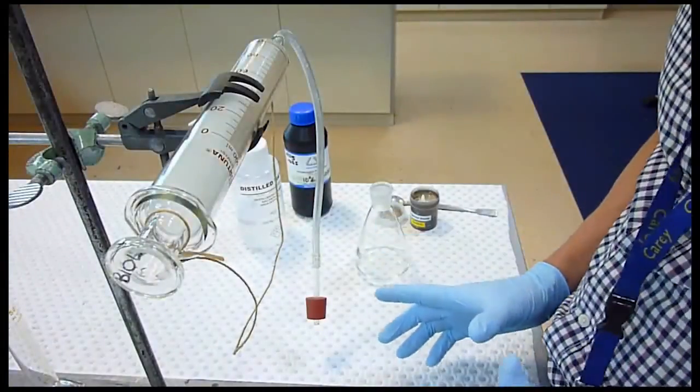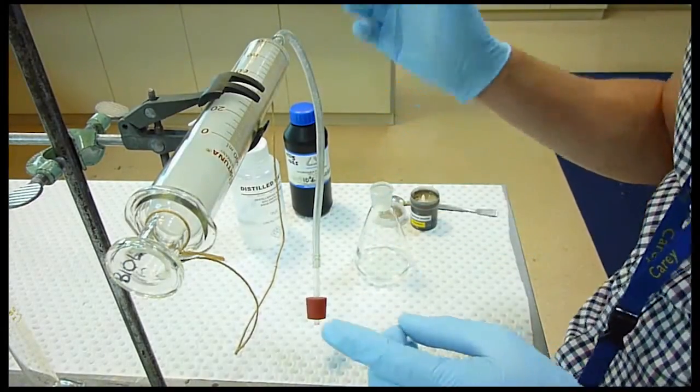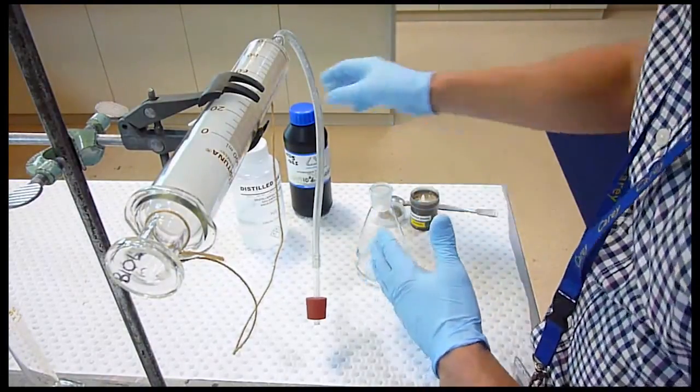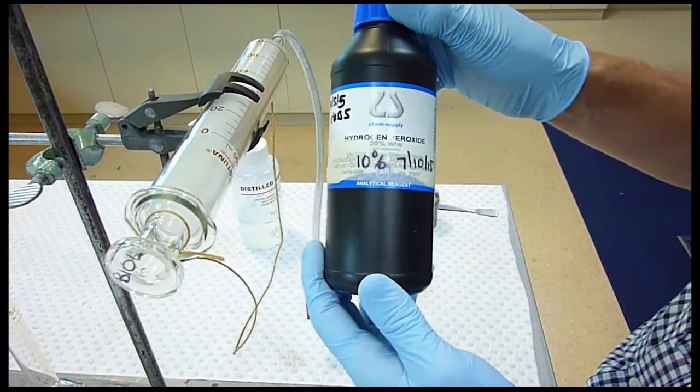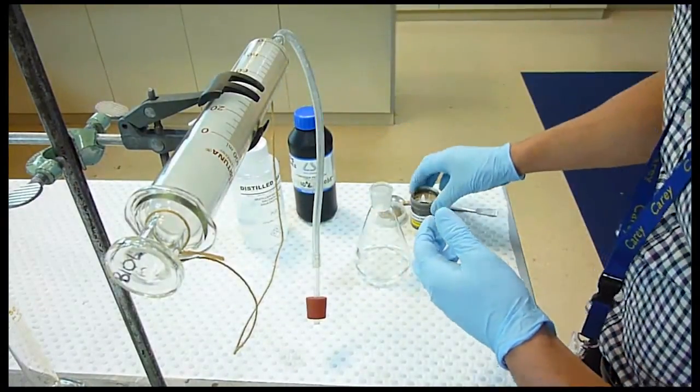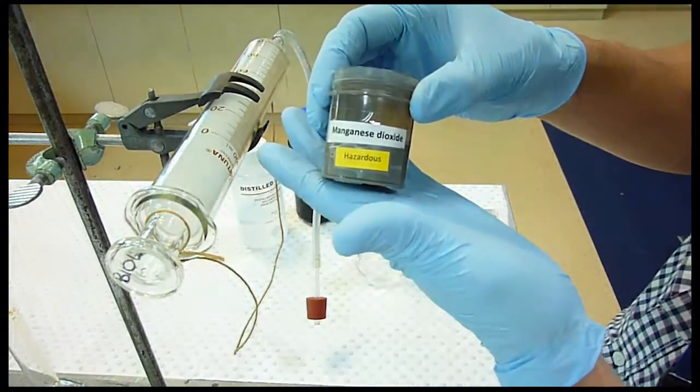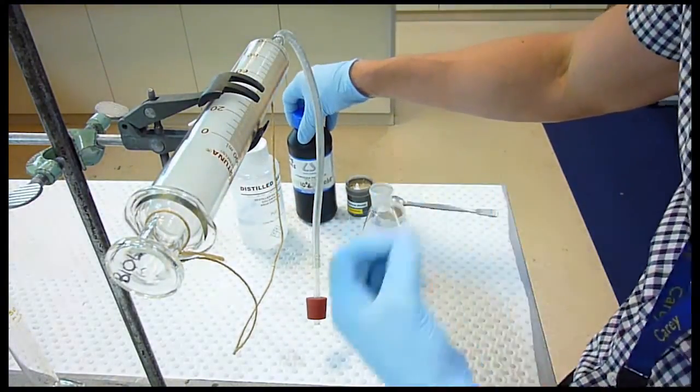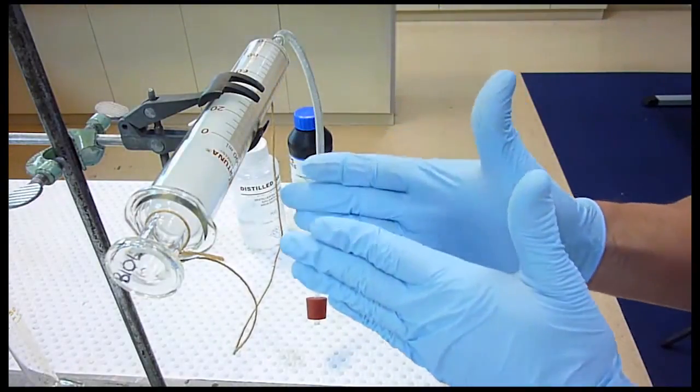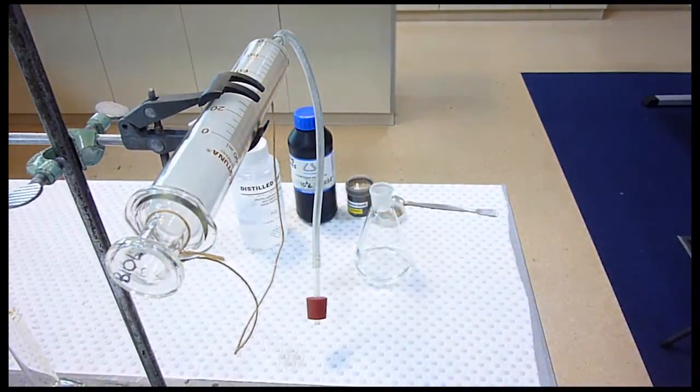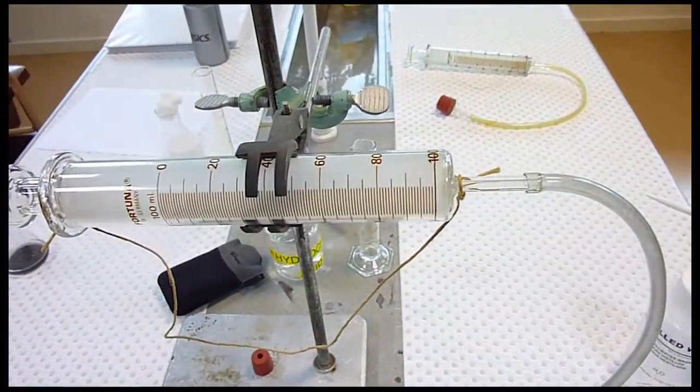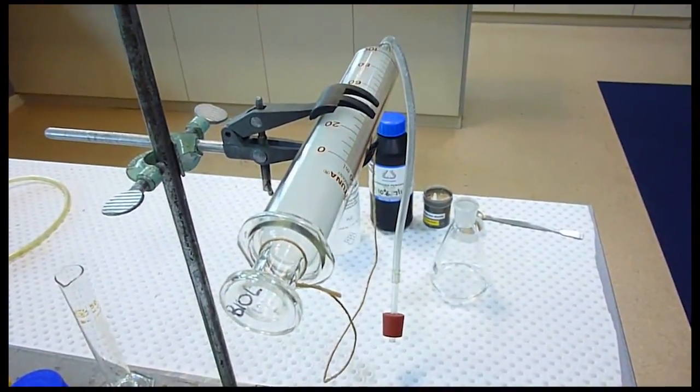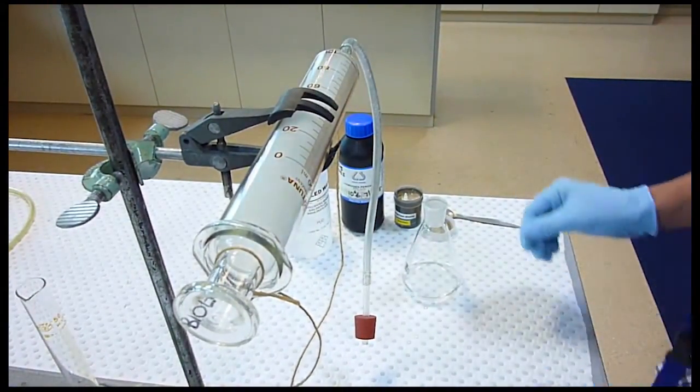Alright, this one's slightly different. Perhaps I wanted to measure the volume produced, so I'm using a gas syringe here. The reaction will take place in the conical flask. I have some of my 10% hydrogen peroxide which I diluted a little bit. I've got my manganese dioxide which is the catalyst. The catalyst will break down the peroxide, forming water and oxygen gas. I can measure the oxygen gas in my gas syringe set on zero at the moment. I can take readings at different times to allow me to calculate the rate. Let's give it a go.